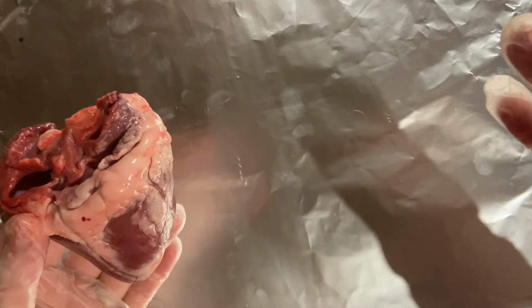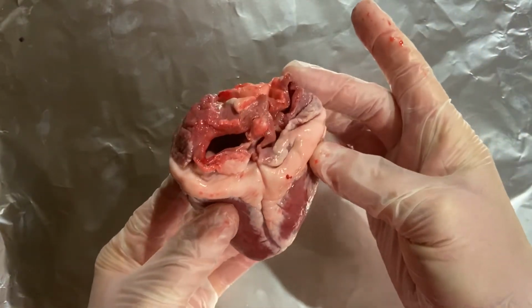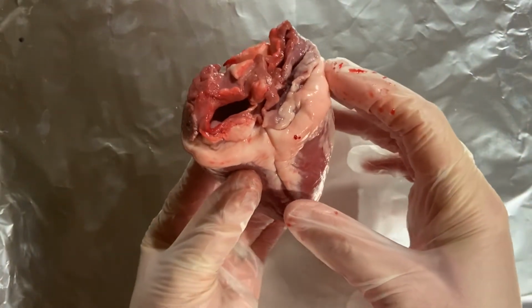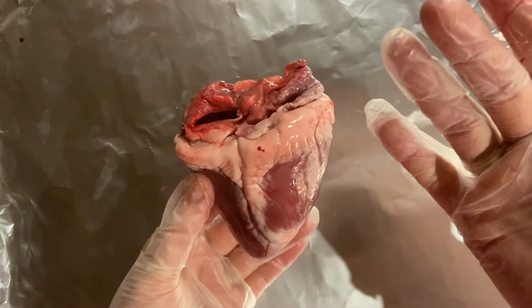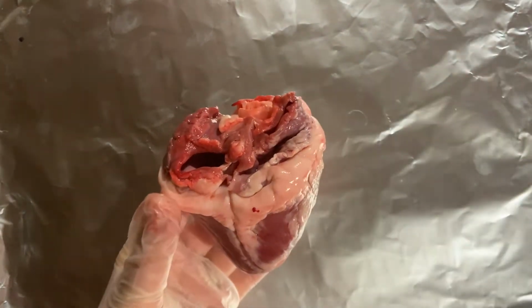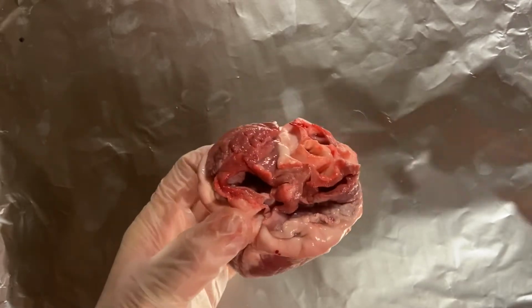Now, before we do that, I just want to give you a reminder. When we look at the heart, because when it's inside me, it's a different direction to when I lay it down, the right and the left hand side is mixed up. So I'm going to show you that in a few moments, but let's just dissect it and see what we can see.